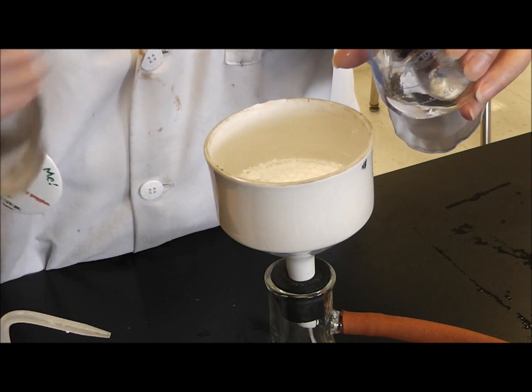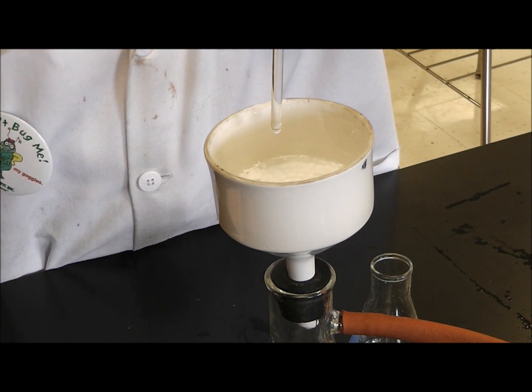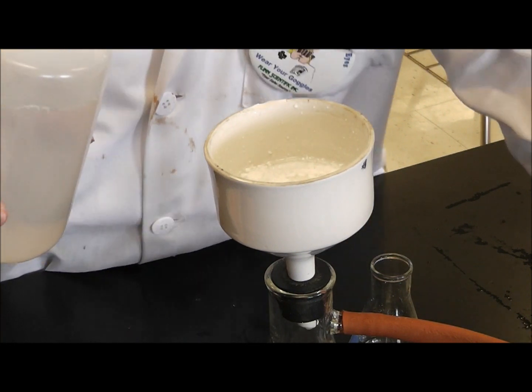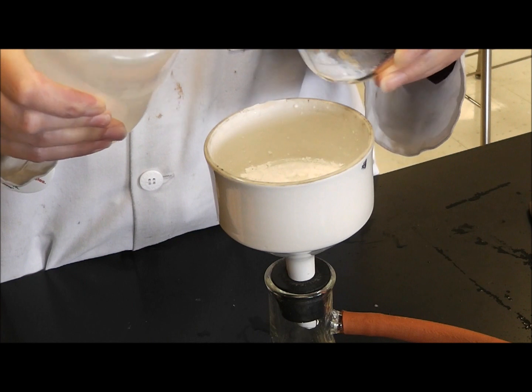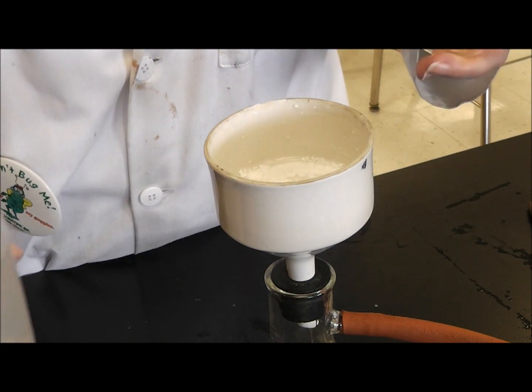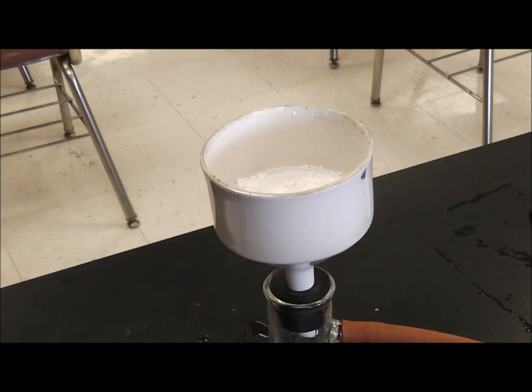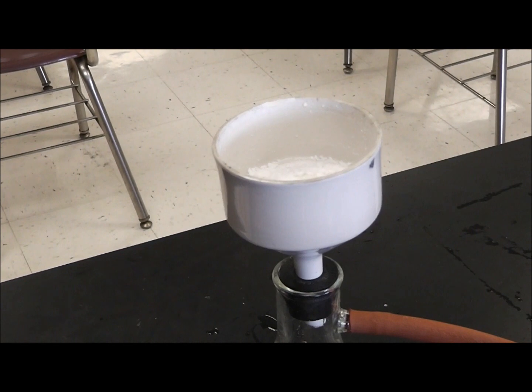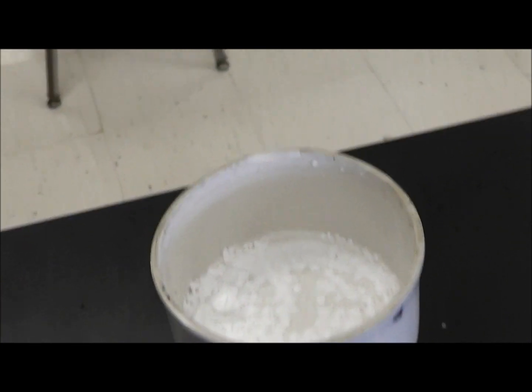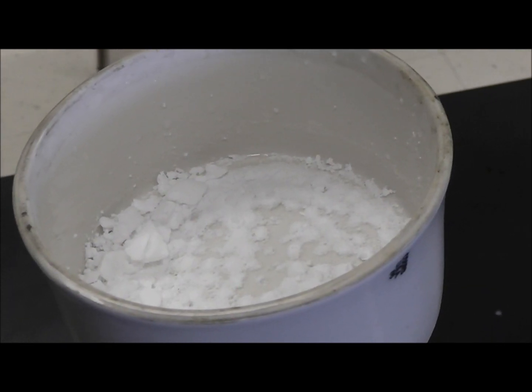Including my rubber policeman. I am going to wash my rubber policeman. I am going to rinse that out. I am doing this with cold distilled water. I am going to wash my aspirin a little bit in there. Oops, I just got messy. Don't do that. There is my Erlenmeyer. There is that. What I am going to do is kind of give you a view of what it looks like inside. Again, I am going to take you off my screen. And actually give you a very nice view of what the aspirin looks like inside the Buchner funnel. That is crude aspirin.